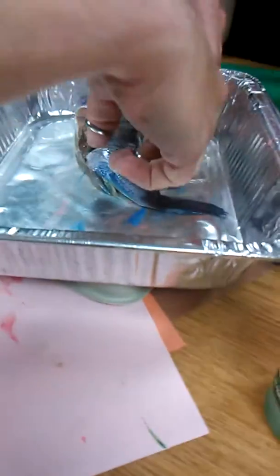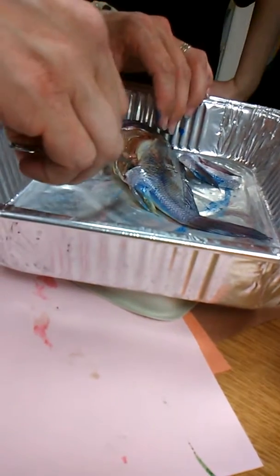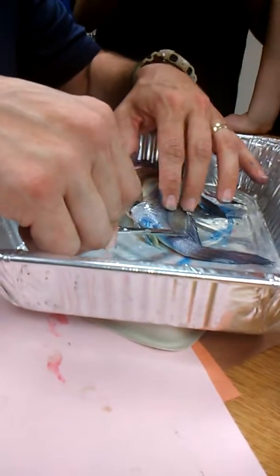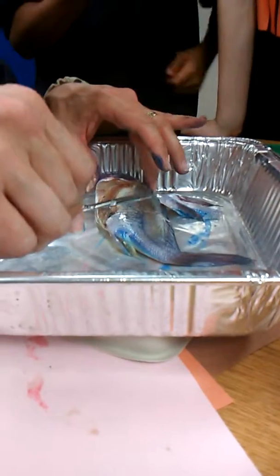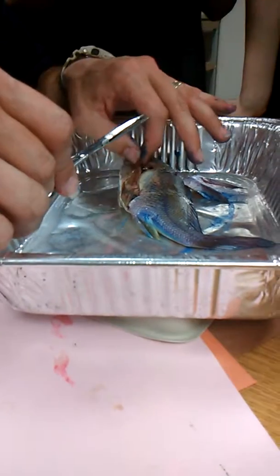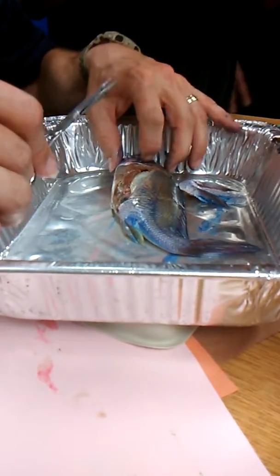That would be part of what you ate if this fish was prepared. To eat the fish, you can't have them preserved with all of their guts in — that doesn't lend good flavor. Also, the scales have to be removed if you want to eat them, because it's like eating 5,000 fingernails, which would be gross. I mean, I've eaten scales before.